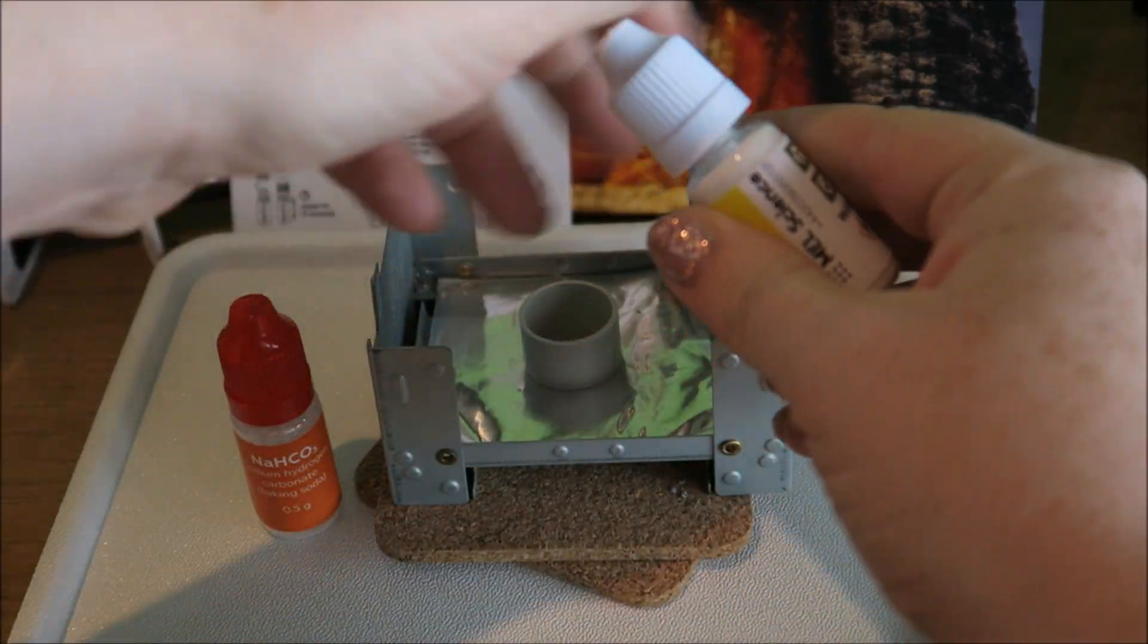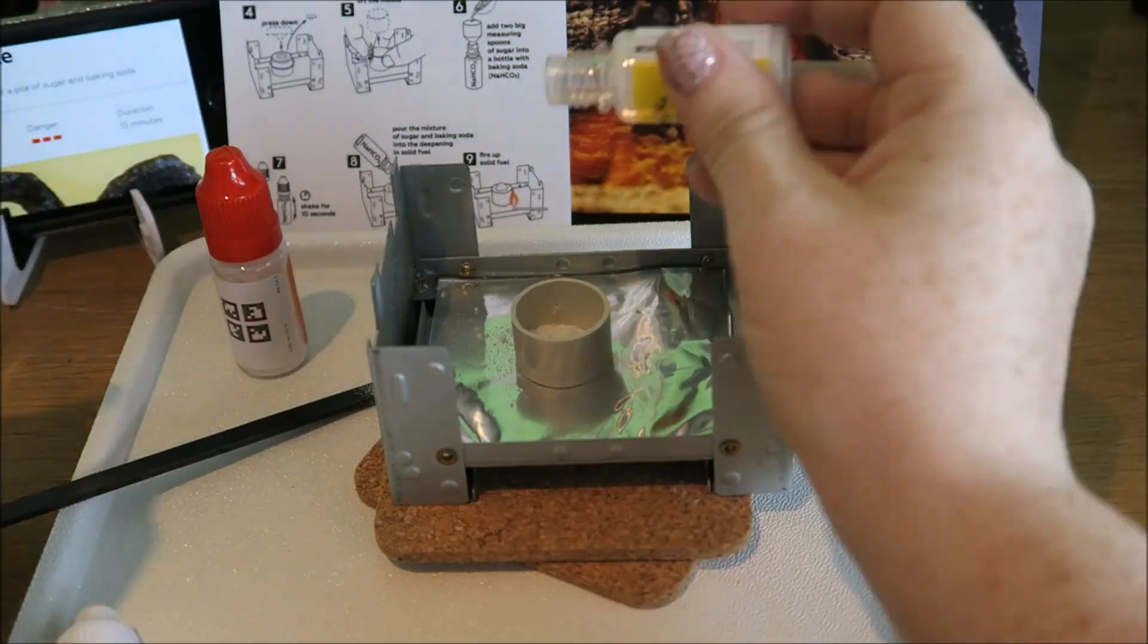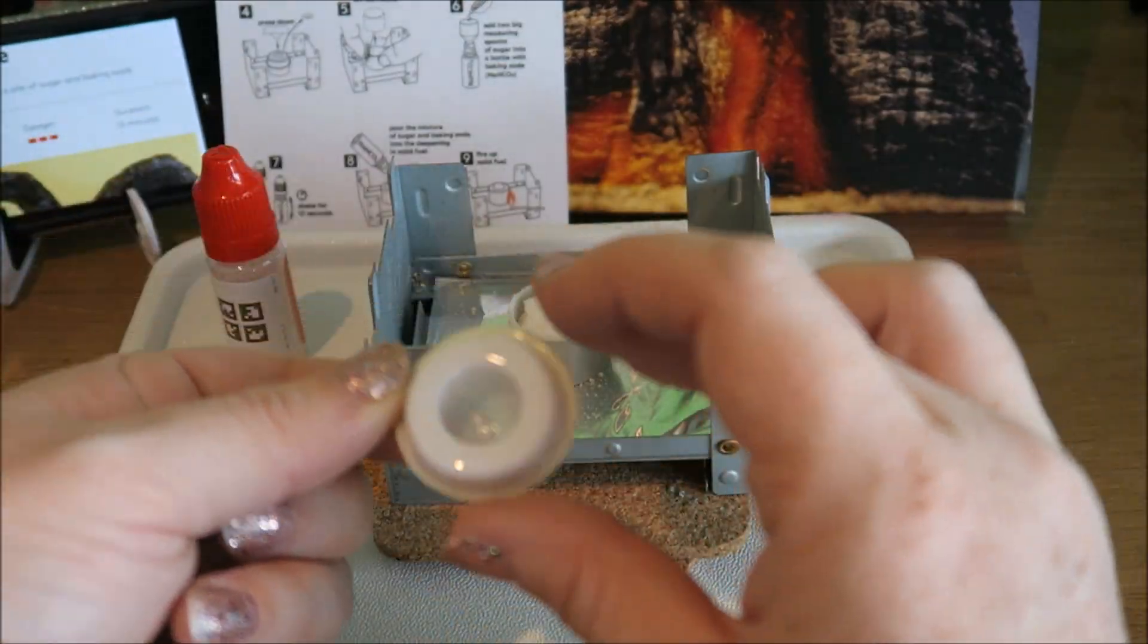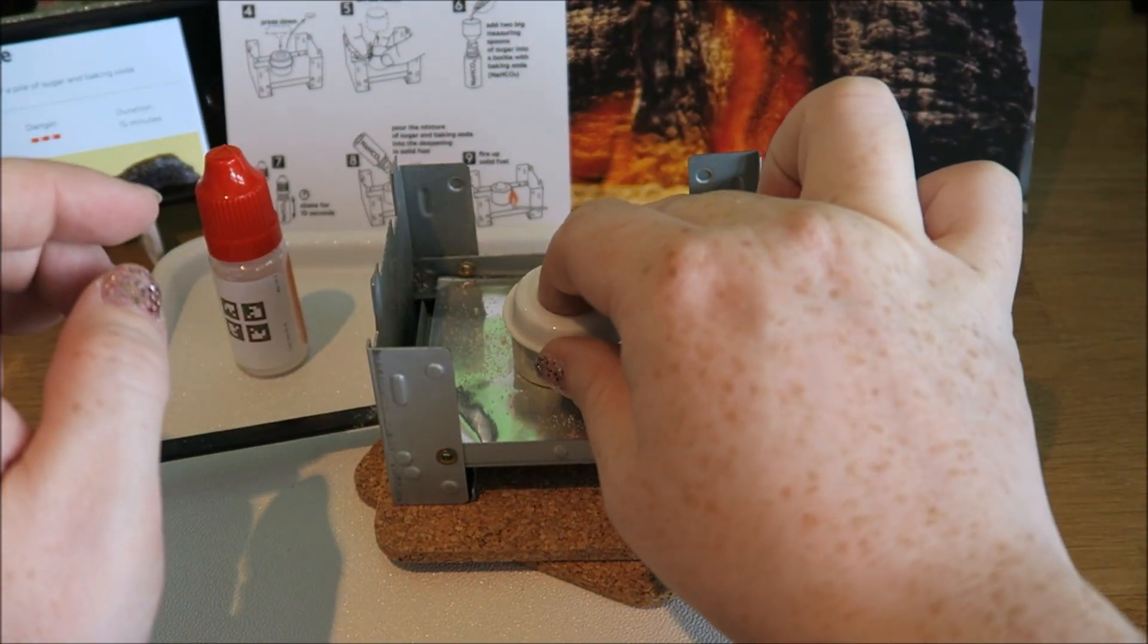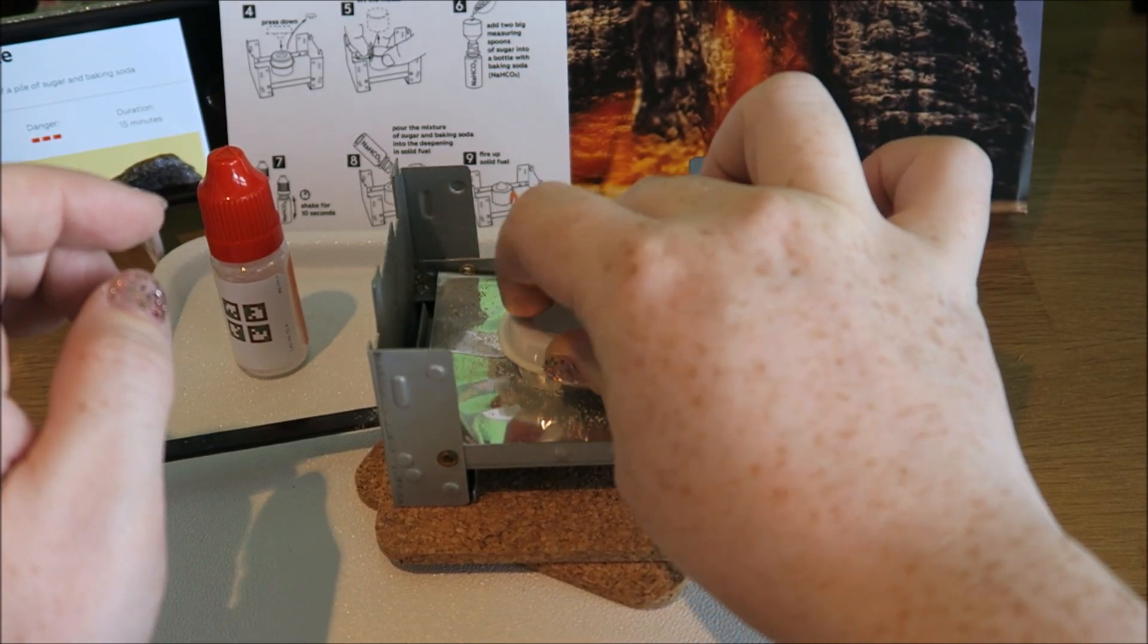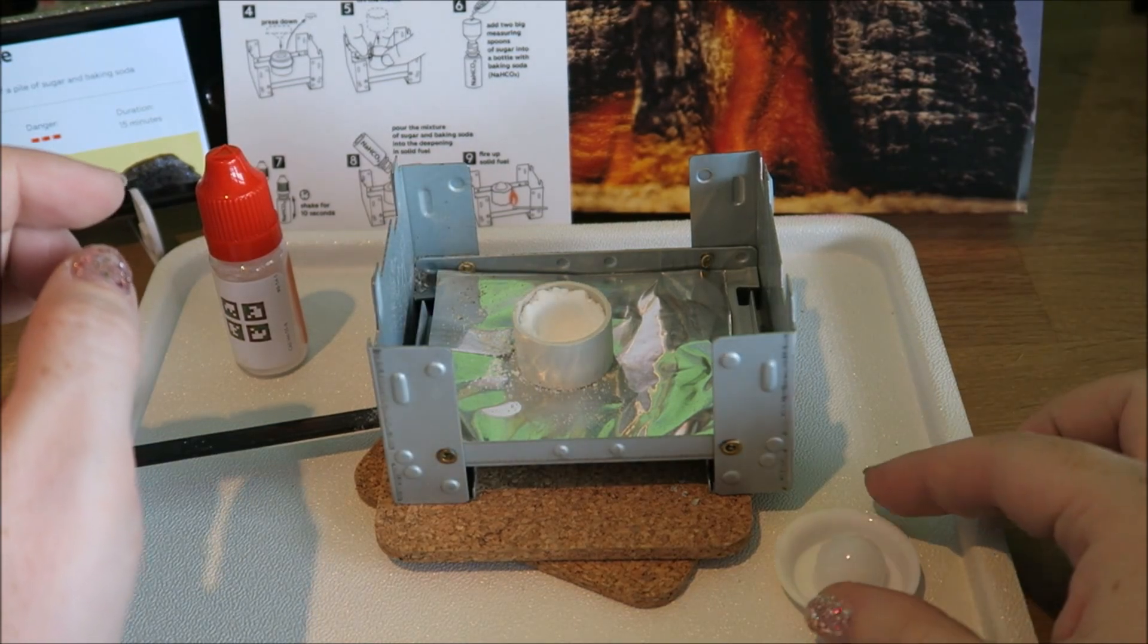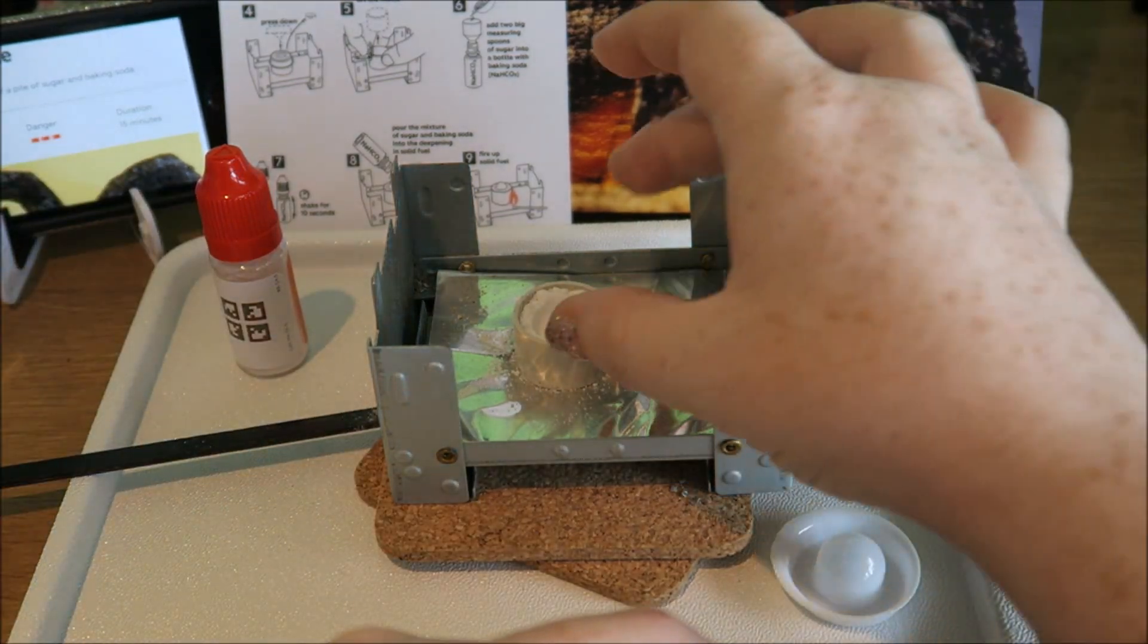Then we use this little doodad to make a mold. Push that down, tap, lift. Then I'm going to take this bit off as well.